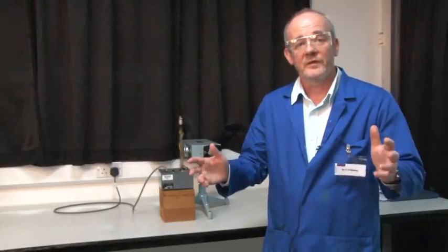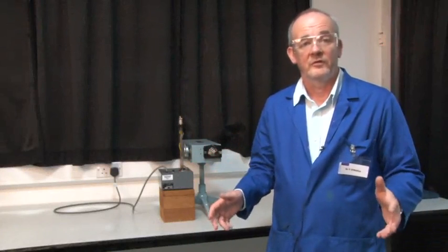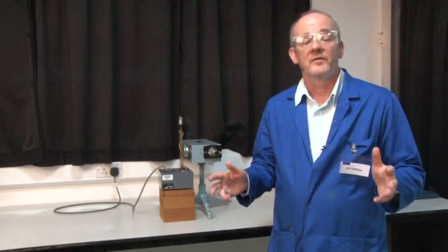Hi there. We're in the physical chemistry laboratory this week, where we're going to measure the emission spectrum of hydrogen in the visible region of the electromagnetic spectrum.